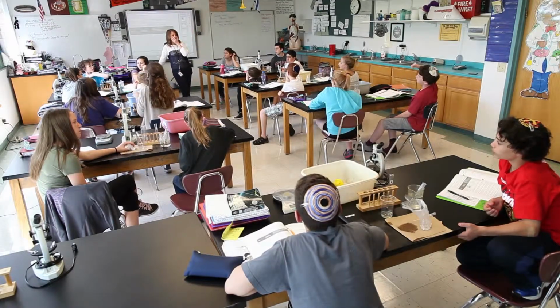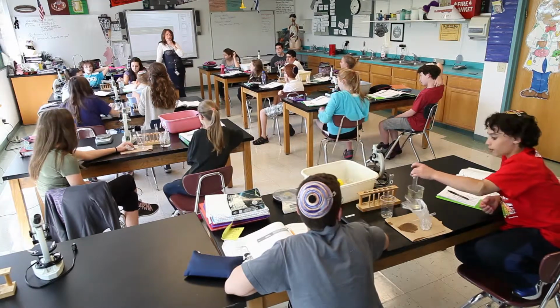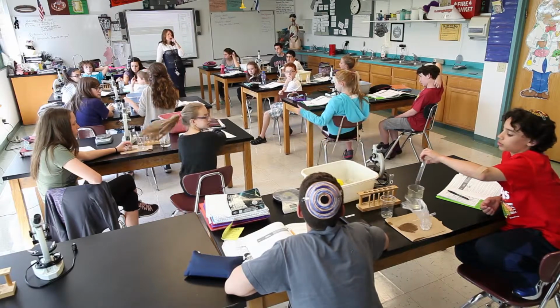Reactions on your table? No. Groups with sugar, you got some reactions happening at your table? Ours is red. It's reddish. At the top.